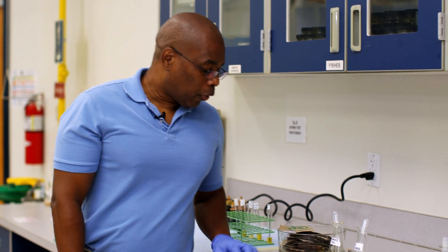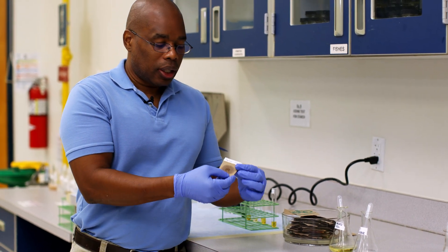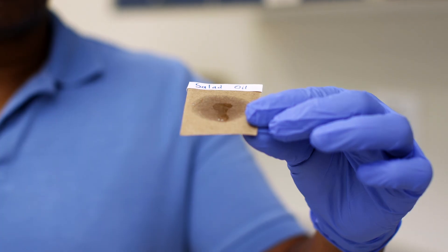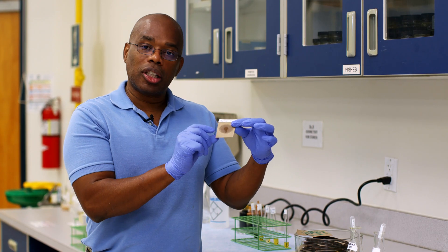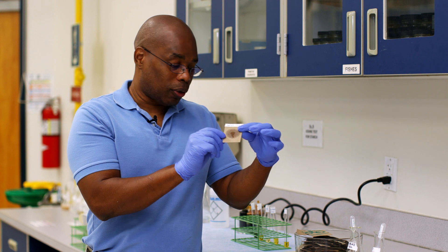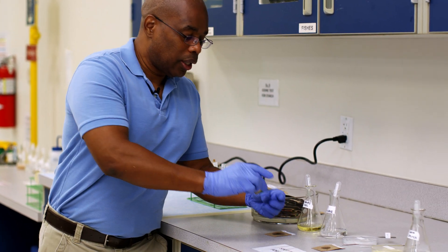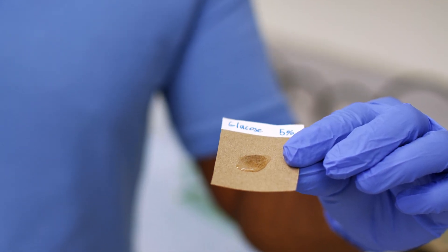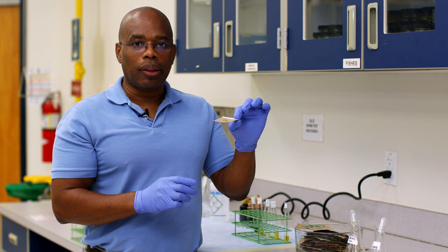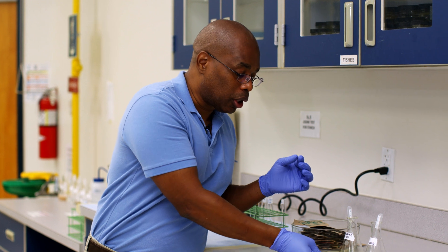Let's look at the results of our Spot Test. The first solution we had was the salad oil, and as you can see, it was well absorbed by the paper — this has fats and oils, and this is our positive control. Our next solution is glucose, and again, you can see that although it wetted the paper, it was not absorbed. This is a negative control — no fats or oils were in our glucose solution.